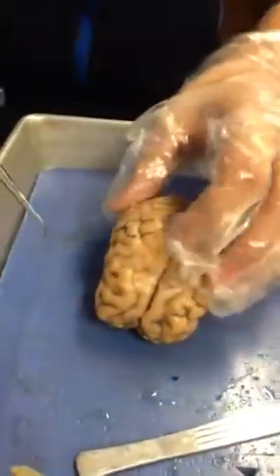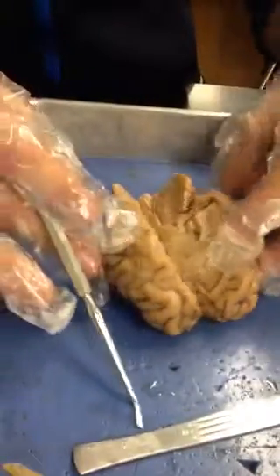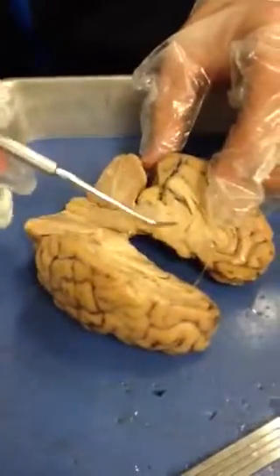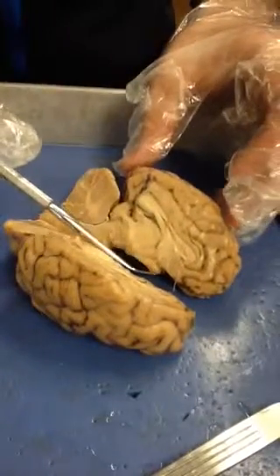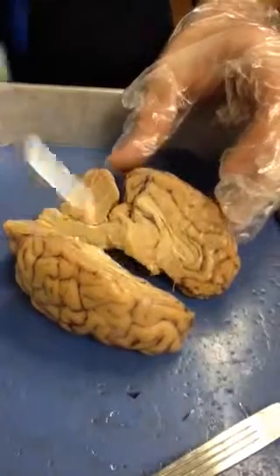And inside of the brain, we have our hypothalamus and our thalamus. Right here, right above our hypothalamus, is our thalamus, and that actually sorts the data throughout the brain. And the hypothalamus controls our hormones.